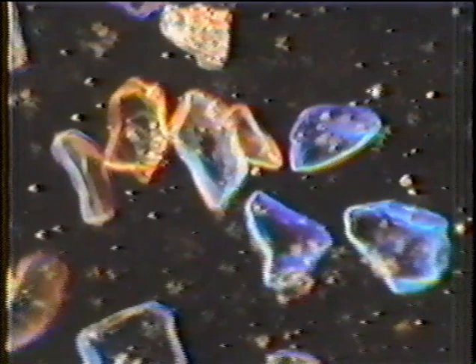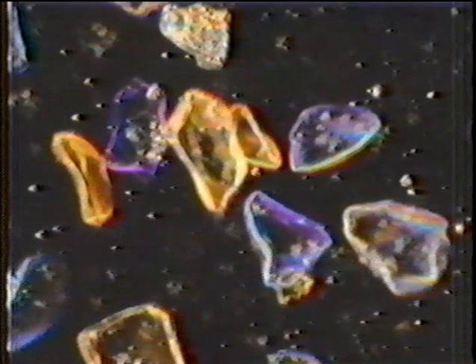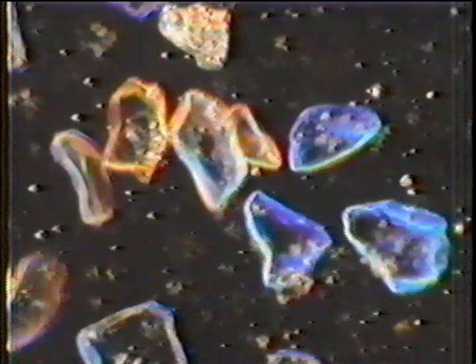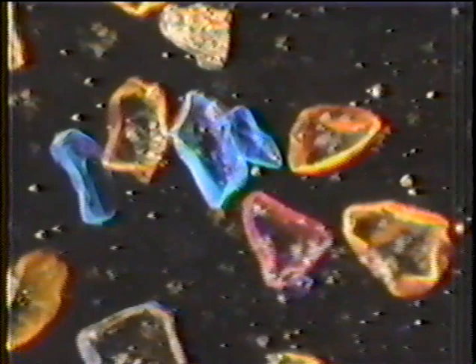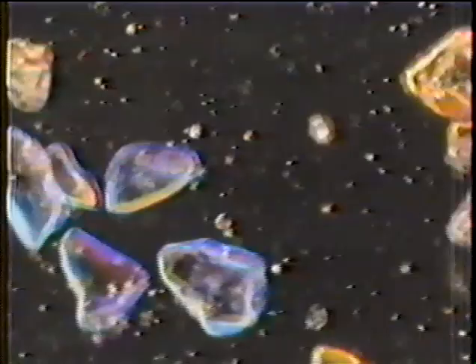Let's see how a biaxial crystal behaves with dispersion staining. Olivine is a moderately birefringent biaxial crystal, and here we see it in 1.660 liquid. With the rotating polarizer, these olivine crystals show index and color variation, but no single color that all uniaxial crystals show during rotation of the polarizer, so it isn't uniaxial. Any crystal showing no color change will be a beta-beta view or an optic axis view. Most of the colors range from yellow to blue, but let's look for an optic axis view. It has to be one that shows no change in color, or at least a very slight change — here's one.